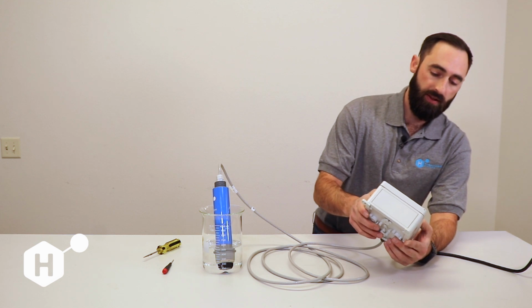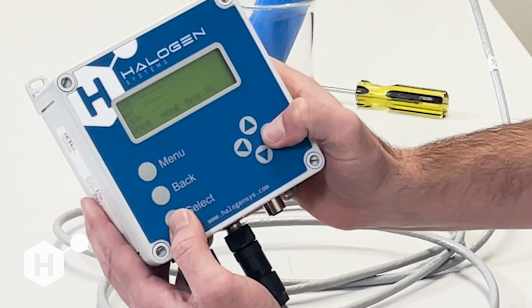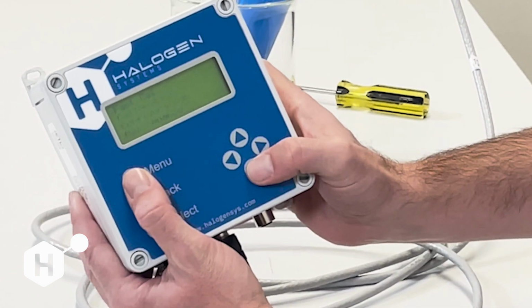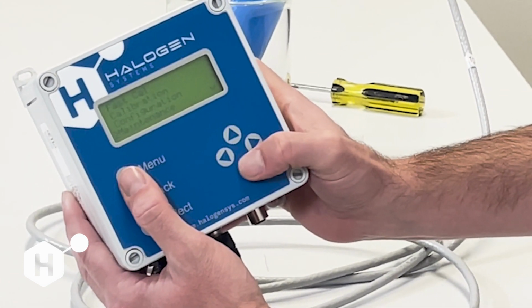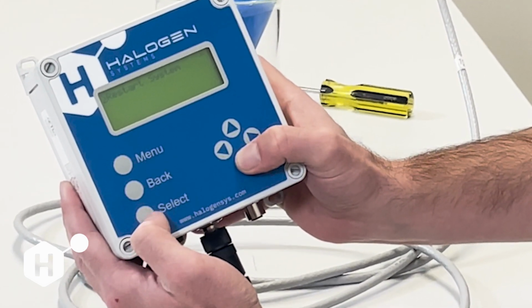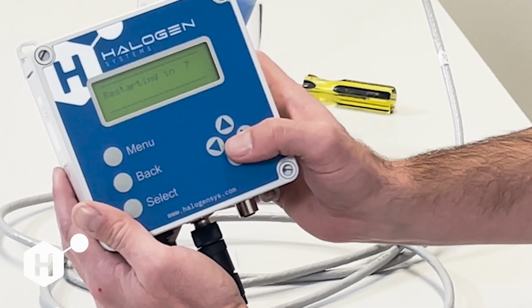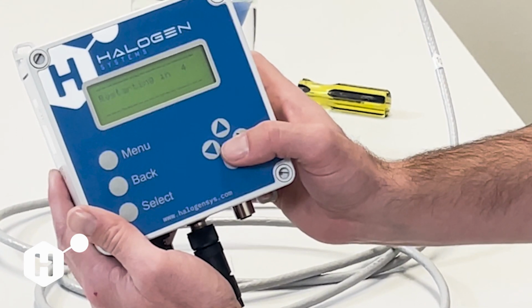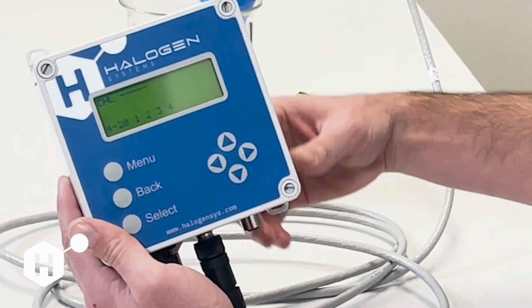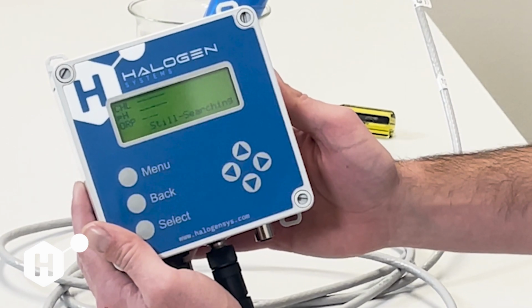And then the next way that we can establish communication here is with the long menu active by holding select and right arrow. We're going to navigate to the maintenance menu, scroll all the way to the bottom and select restart system. And this is going to restart the display and send a restart command to the sensor. And whenever this display restarts, it is going to reestablish communication by initiating a bus search again. So this is the second way to establish communication.